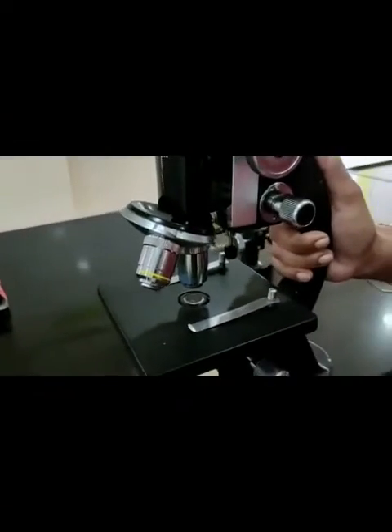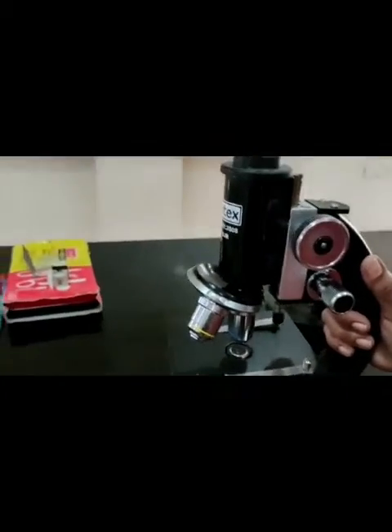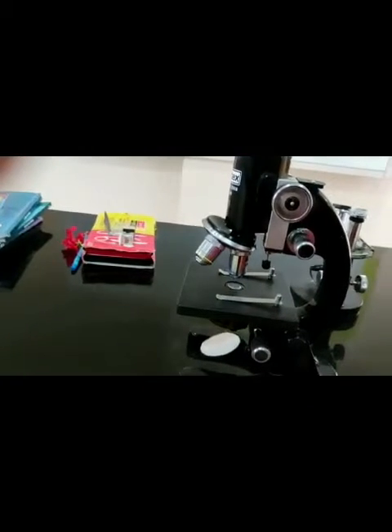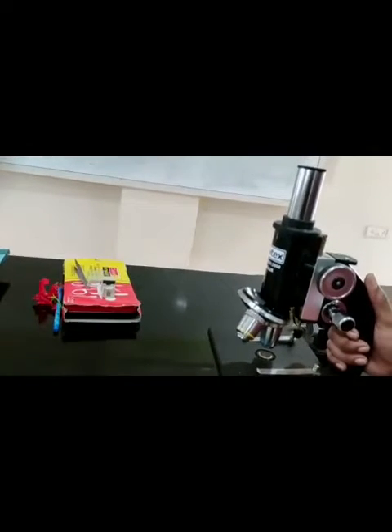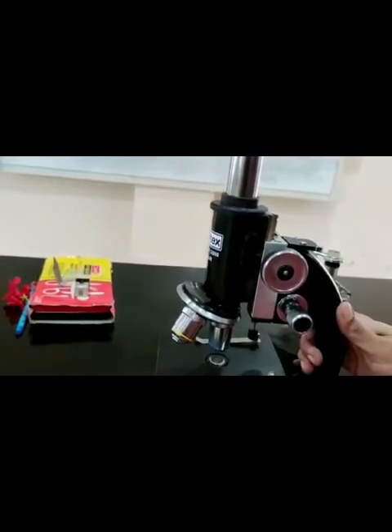The compound microscope can magnify an object 10 times or 45 times. Suppose an object is only 1 mm in length — when we view it through the 10x lens it is going to appear like 1 cm in length. That way the magnification or resolution can be increased by using different objective lenses.